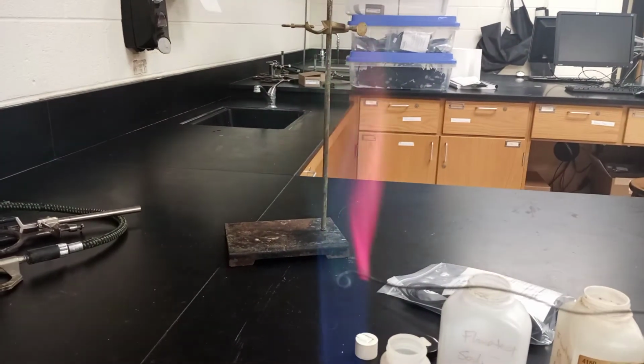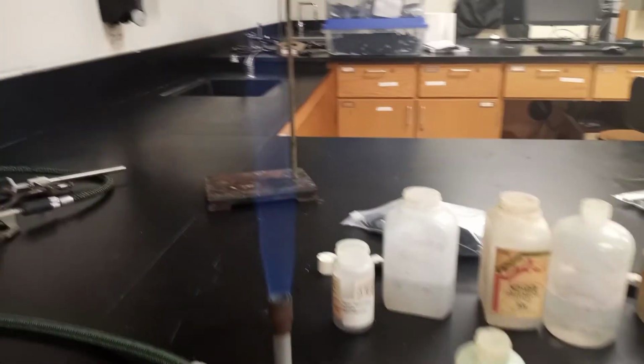Okay, there we go. All right, now I'm going to quickly run a couple of these ones just with the lights off here and see how well this turns out. And if it works out better, then there we go. All right, this is my lithium. There we go. Nice purple red.